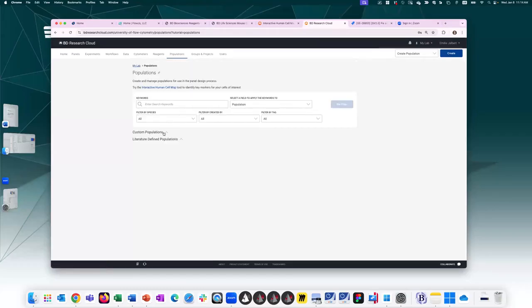Within this population section, you can add custom populations. So in this case, I created this EJ Treg. EJ are my initials. In this Treg definition, I've assigned CD3 as a medium antigen density marker for this population of interest. CD4, I've assigned as a high antigen density marker. CD8 is negative, CD127 low, CD25 high, and FOXP3 low. So later I'll be coming back to this population to show how to use it within panel creation.